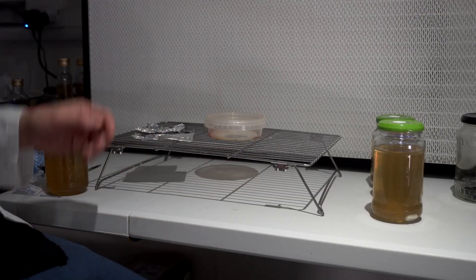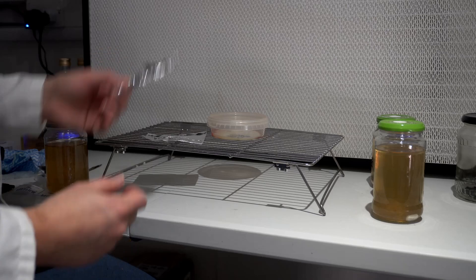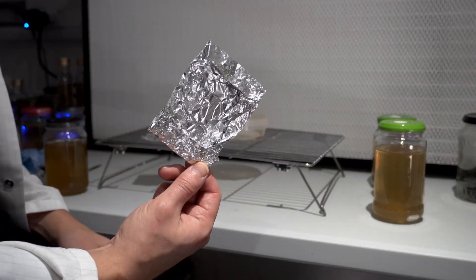This video is going to show you how to turn a spore print into liquid culture. We're going to go from spore print to agar and then finally transfer into liquid culture.